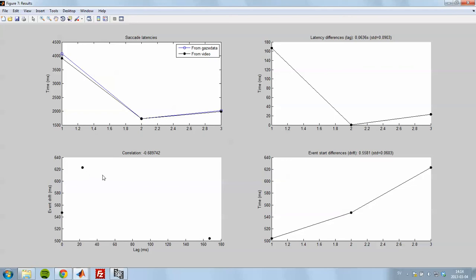And you also get the correlation between the event starts and the latency differences. So if you have a correlation here, it's a sign that your stimulus program is sending the event trigger to TimeStudio, but it's actually not showing the image right away.